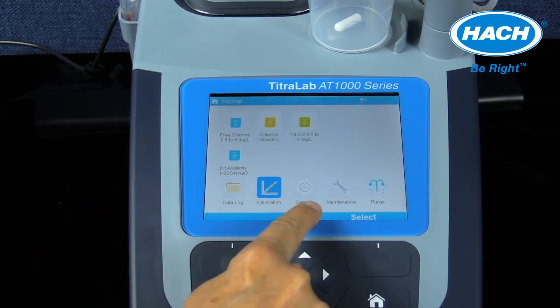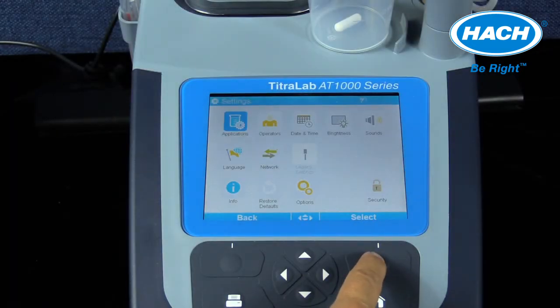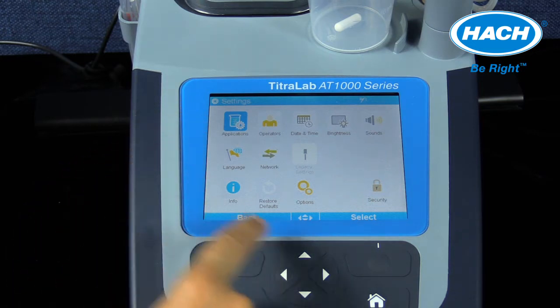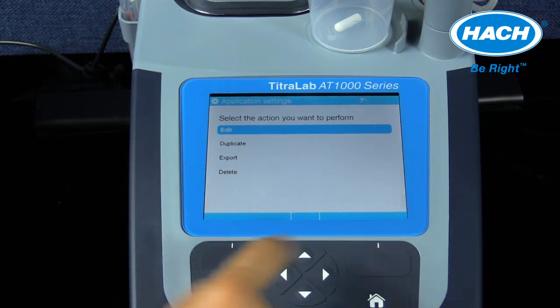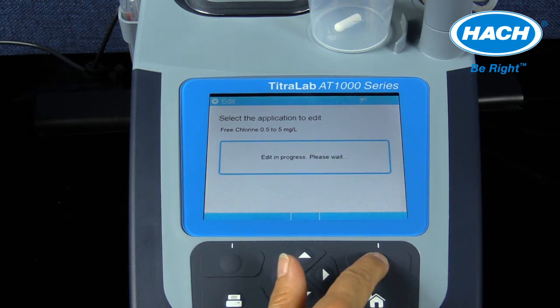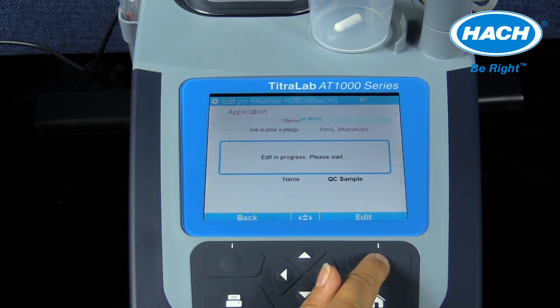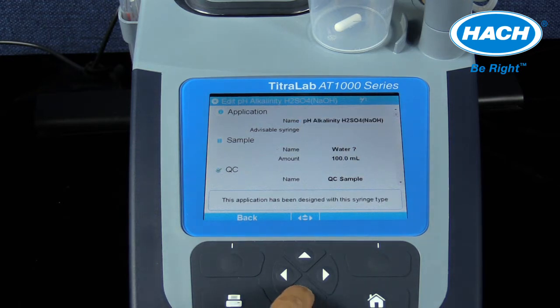Selecting the application settings within the setting menu, the software will allow the editing of the loaded application, including the desired pH buffer calibration standards. There are 5 steps to changing the pH buffer calibration standards. Step 1. Select Edit on the application settings menu. Step 2. Select the appropriate application you need to edit. In this case, the pH electrode that is being calibrated is in the pH alkalinity application. Step 3. Scroll down to the electrode heading and the title PHC805.